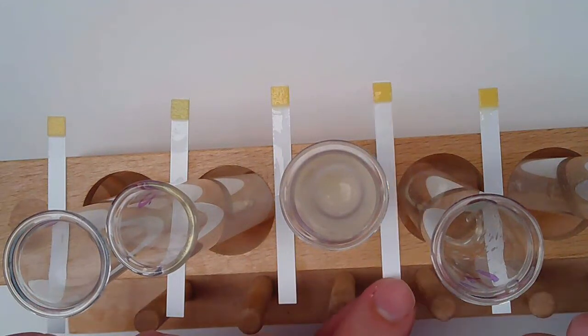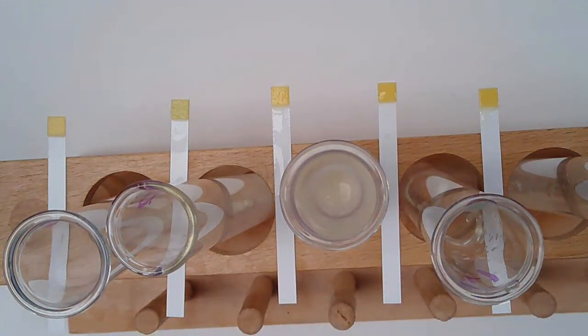Now remember, what should be happening here is, if in any of these test tubes we were able to hydrolyze, again, the name for the reaction, which is going to clip the two disaccharides apart, we'll end up with either glucose and fructose or glucose and galactose, depending on what we're splitting. But we should see the presence of glucose if that hydrolysis reaction was successful.